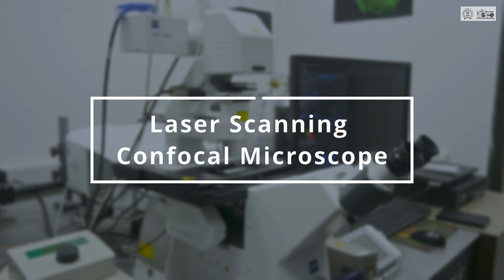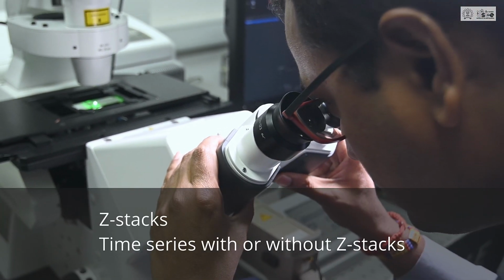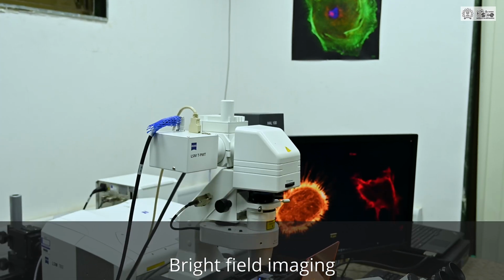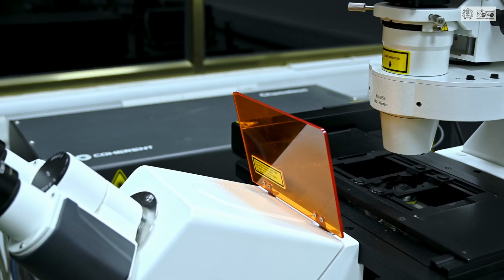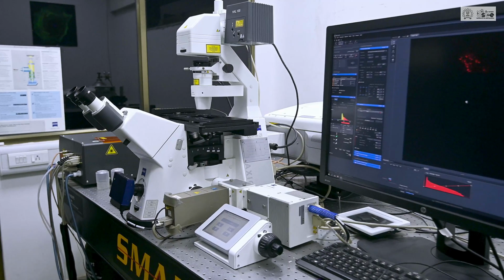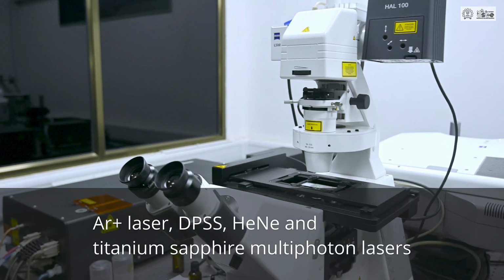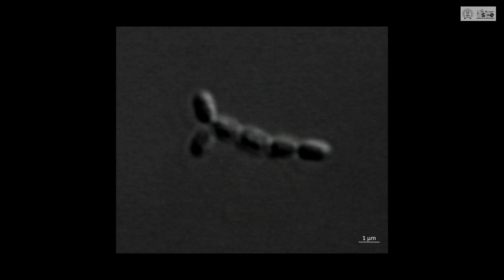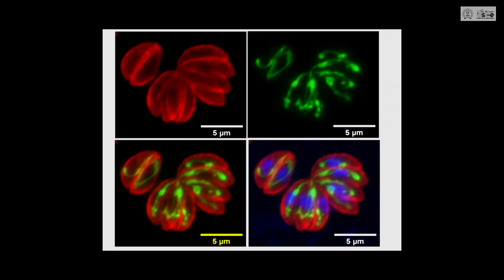A laser scanning confocal microscope uses a laser source and pinhole to block out-of-focus light from the sample. Using optical sectioning to capture images of the sample in different planes and reconstructing these using software, it can create three-dimensional images of samples. The laser scanning confocal microscope at IIT Bombay can make high-resolution images of various types of samples such as mammalian cells, bacterial samples, proteins, yeast samples, and parasites.